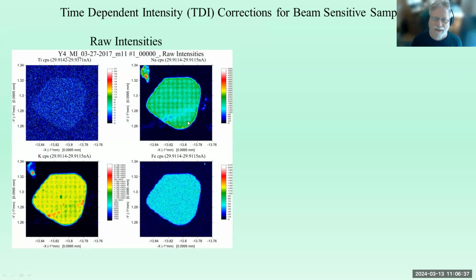And Annette has already talked about the time-dependent intensity correction, and she's going to talk about this more. So I'm just going to point out that you can see some weird effects. This is an effect that was first described to me by Ben Hansen at Corning Glass, where, of course, they're famous for Gorilla Glass, which is in all our cell phones and laptops. But we can get this weird effect, and this is a constantly scanning beam. It's not stopping anywhere, but we're getting these little weird gridding effects here. And it's actually a TDI effect.